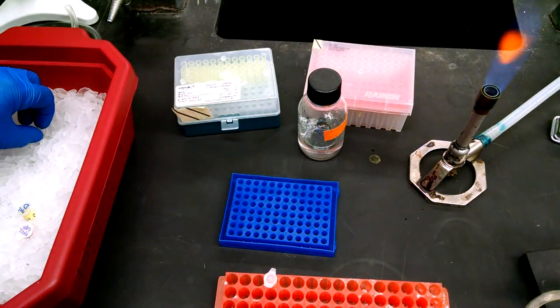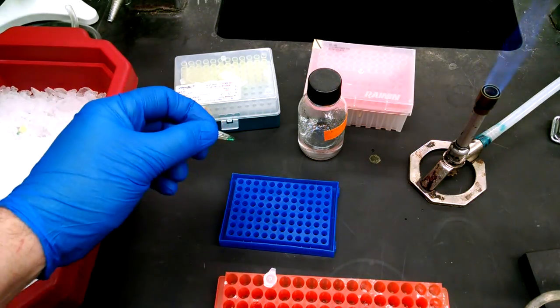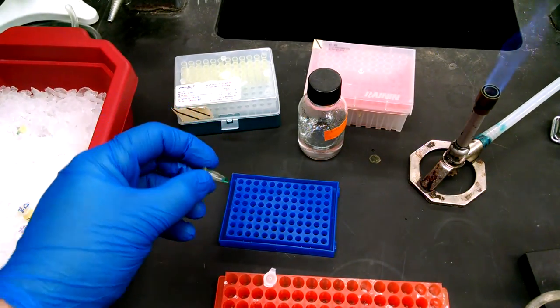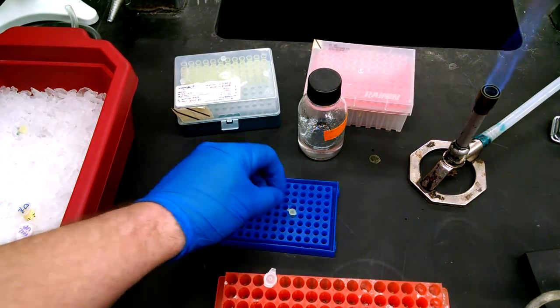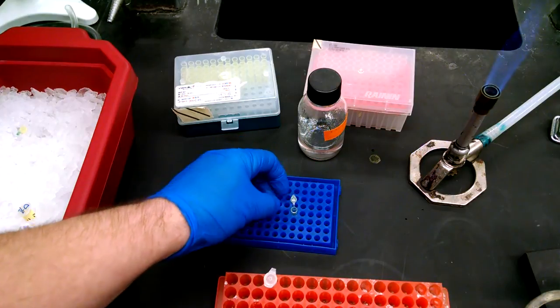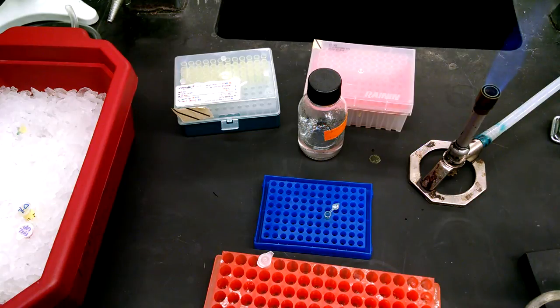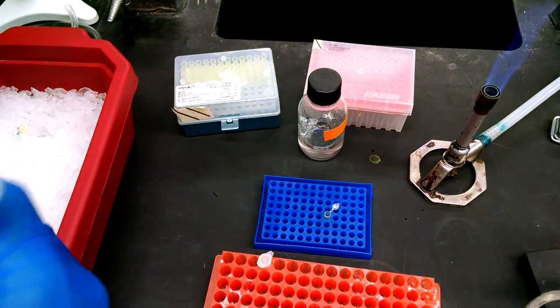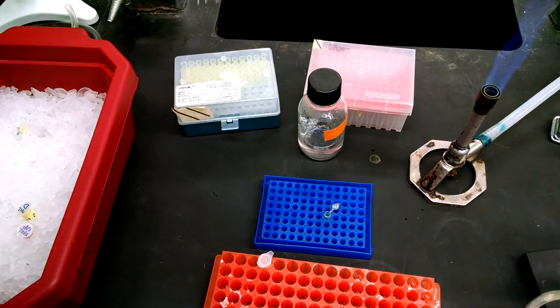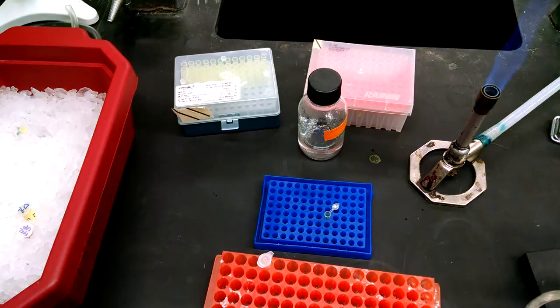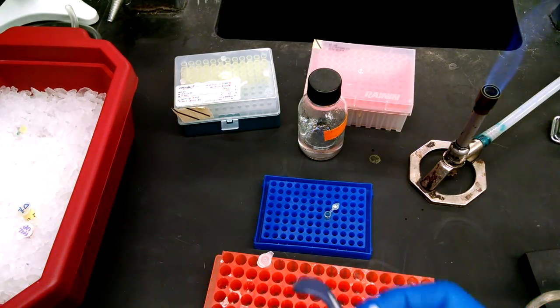So what else do we need? Well, now what we need are the ingredients of the PCR. So what we have here is 25 microliters of MasterMix already in a PCR tube. In this case we have that pre-aliquoted. You may need to put that into a tube yourself. And to that we're going to add the ingredients. So we're going to add 23 microliters of water.